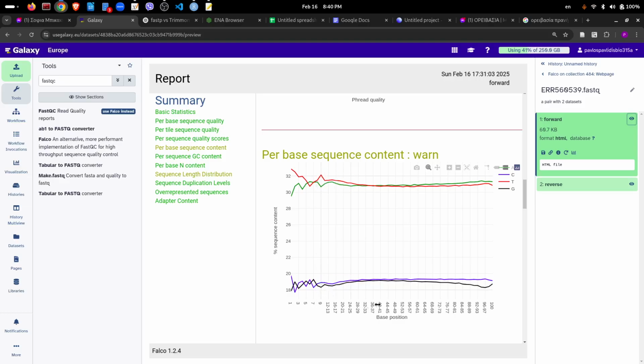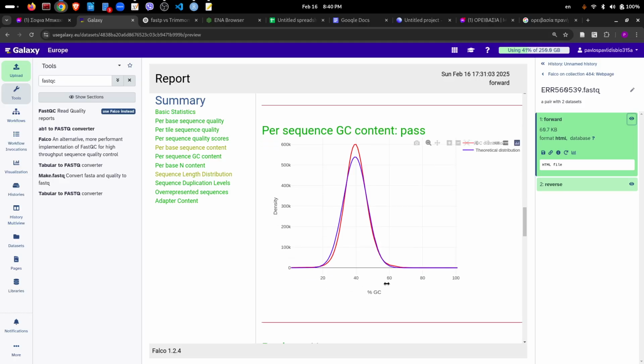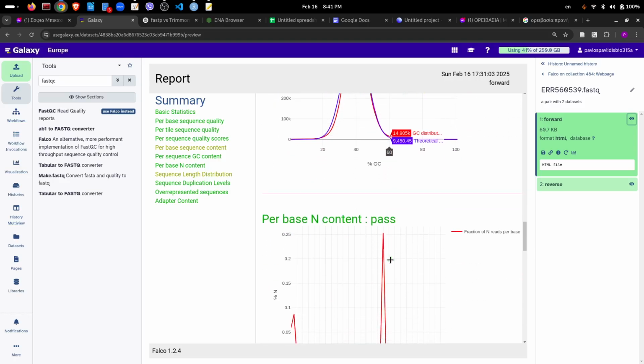The other thing that we observe is that we have an AT-rich genome. Perhaps somebody could check this, if yeast is AT-rich, since we see that A and T is about 30% and CG is about 19-20%. Okay, let's proceed. The GC content is okay. It's about 40%, similar to the theoretical distribution.